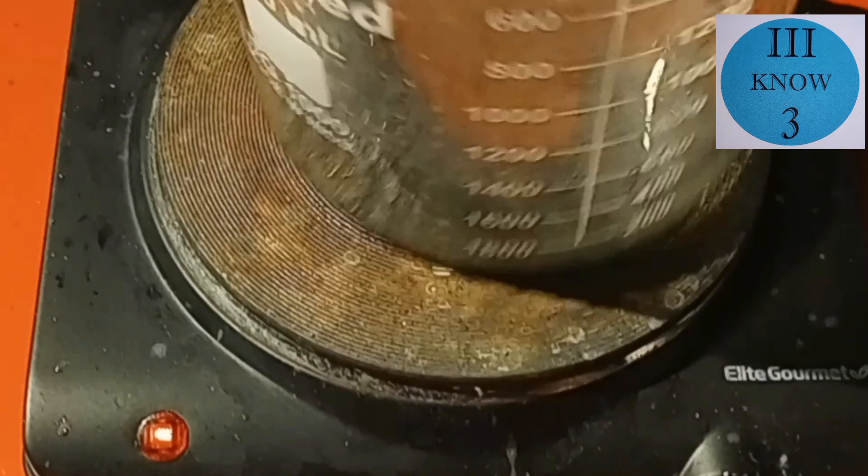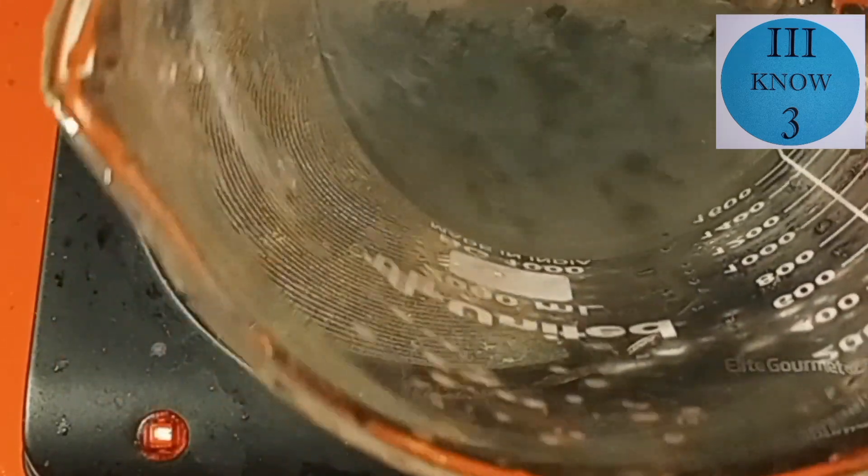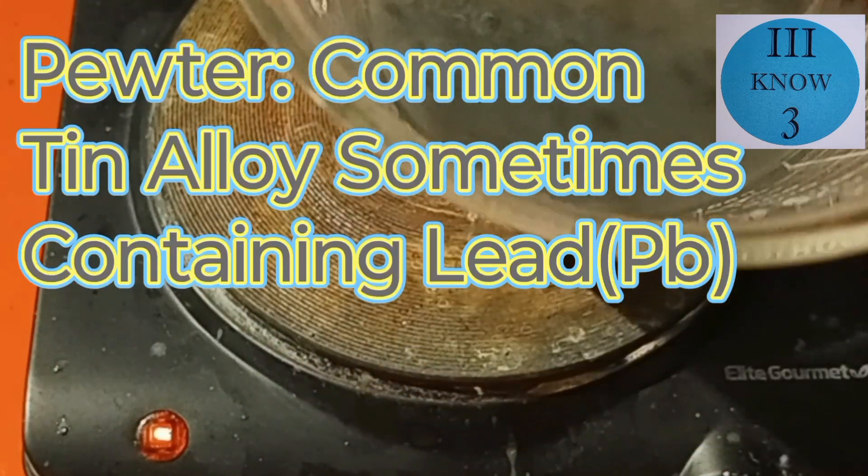and I discovered that the source of his tin was from melted pewter figurines. Here you can see that most everything that is going to dissolve has dissolved, and there's just this black residue left.